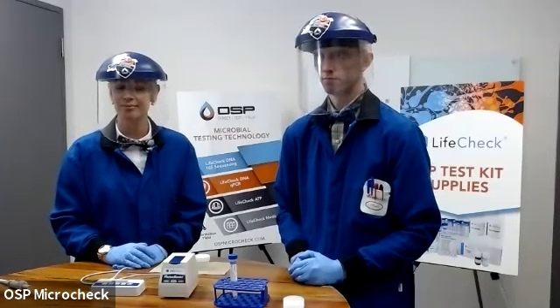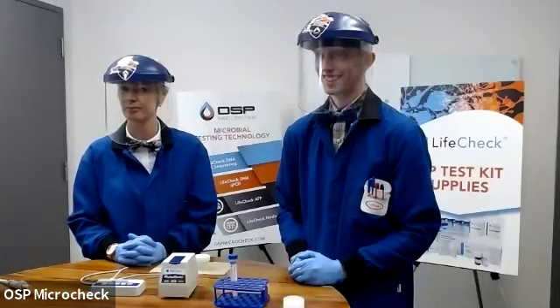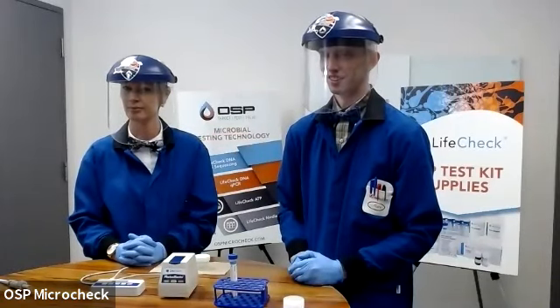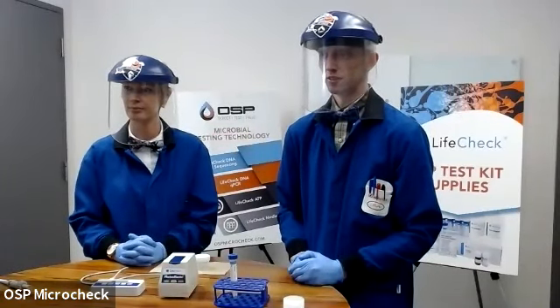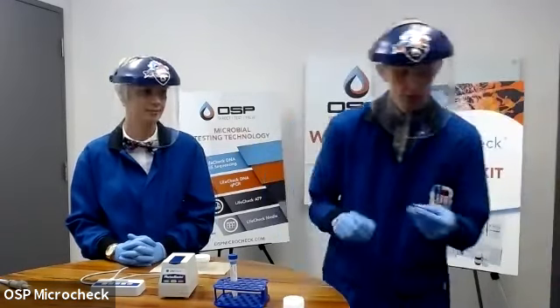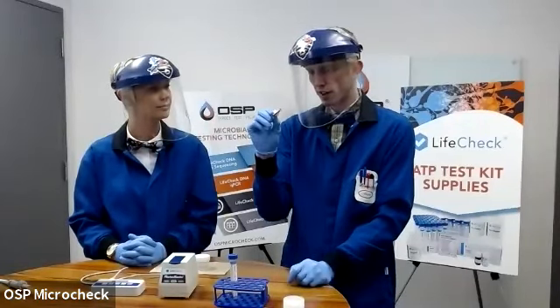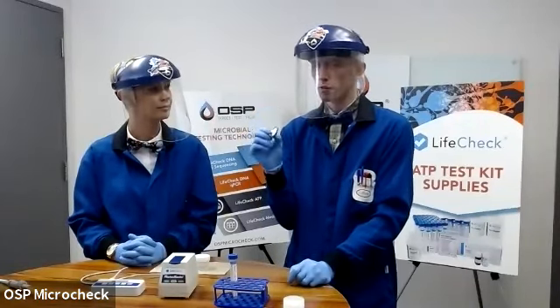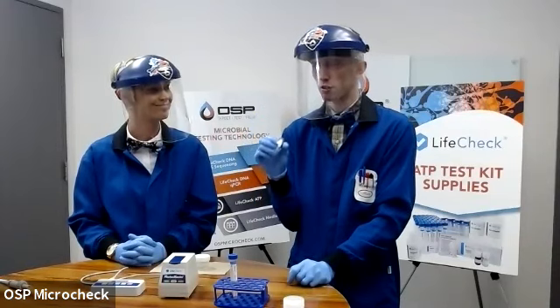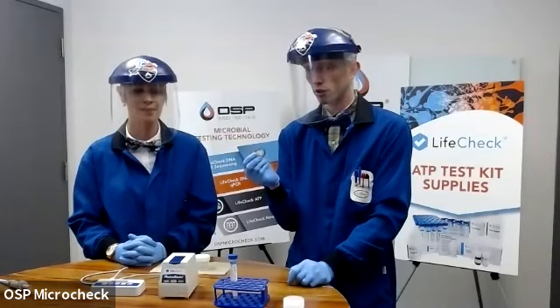So we have two questions. One was in regards to Mark's caulking gun, and a question in regards to at what point do you get concerned about overstressing the syringe and having it break apart? Yeah, so these are all Luer lock syringes, and the syringes that we provide have about 3 threads on them. So they will actually take a fair amount of force to crack open and break. I have had it happen a few times, so you definitely don't want to go too far.